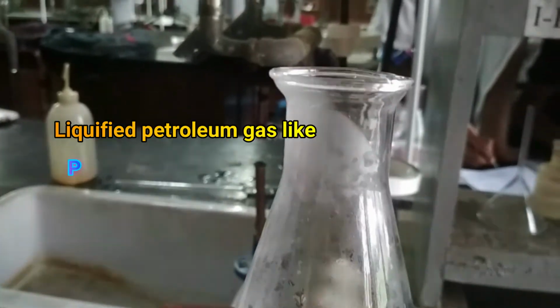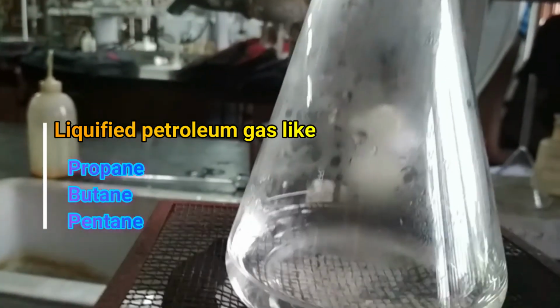If we use a Bunsen burner as a heating medium, in the Bunsen burner we use LPG gas. LPG is nothing but a mixture of liquefied petroleum gases like propane, butane and pentane.